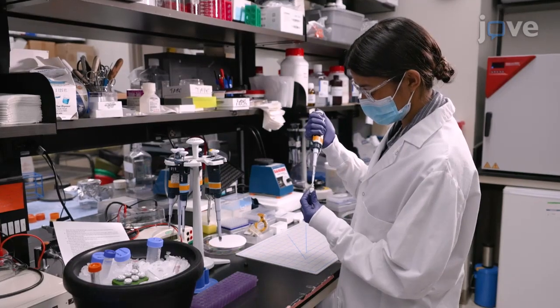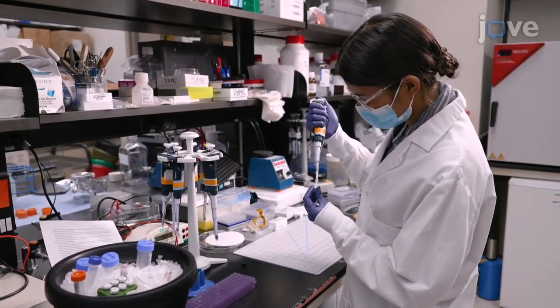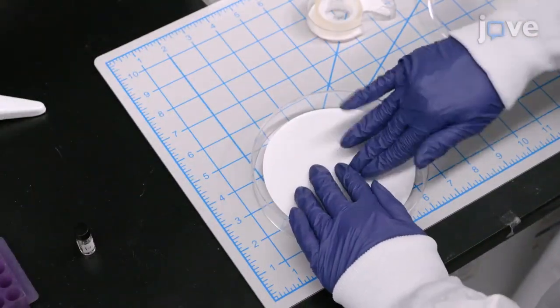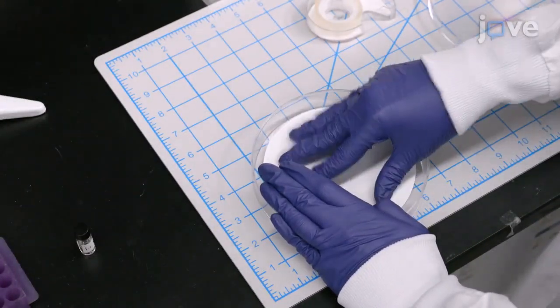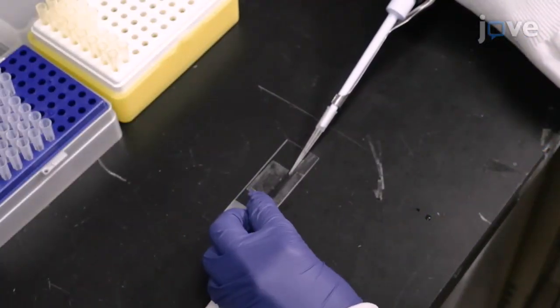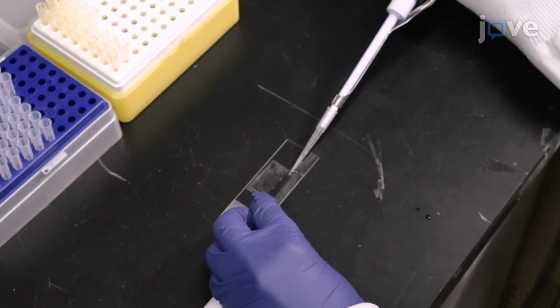These techniques can be used to investigate how disease-causing mutations in non-muscle myosins affect their behaviors at the single molecule and ensemble level. The general approach of this methodology can be applied to various other cytoskeletal systems, such as the characterization of purified kinesins and dyneins with microtubules.